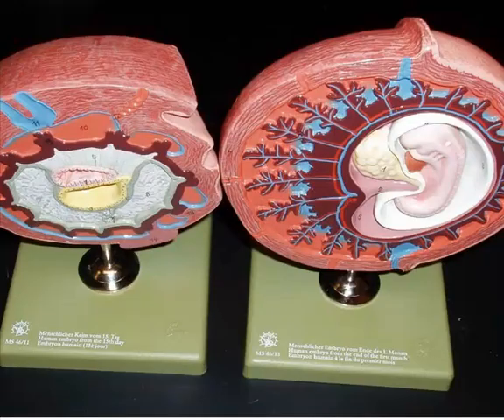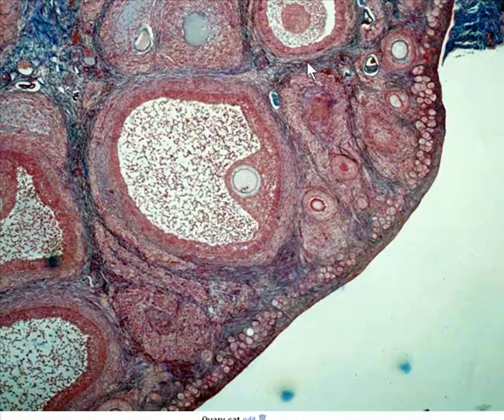Alright, so let's move through to some of the histology. This is the ovary slide of the cat. We also have, I believe, an ovary slide of the rabbit, which you can look at in comparison. So again, this is going to be cortex out here. Medulla is going to be in here. Cortex is where we're going to find the follicles.